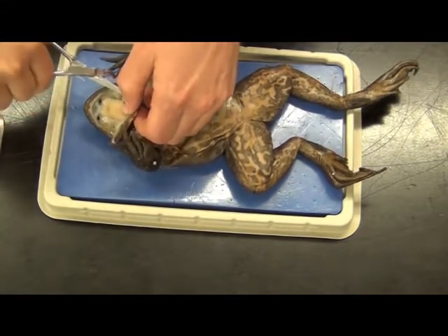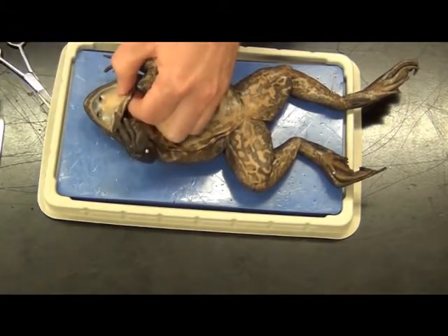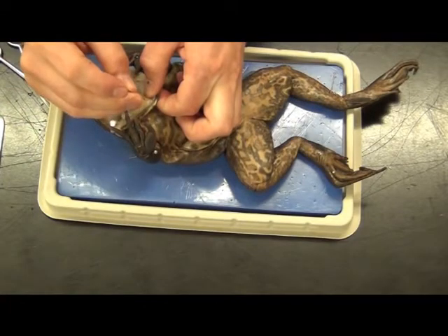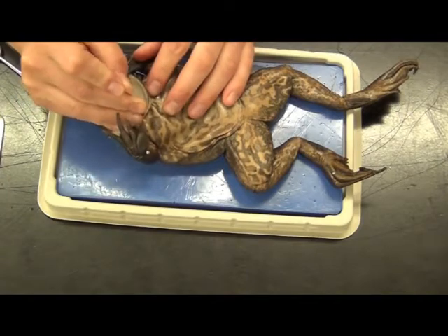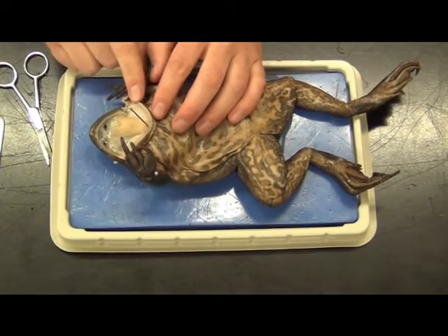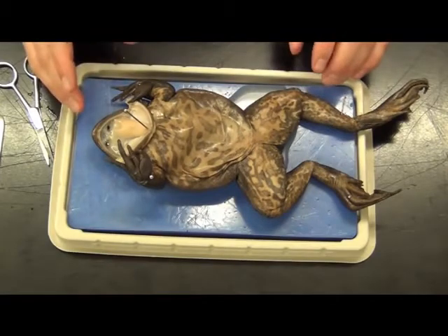I'm going to cut way on back on this guy, almost back to the front legs. Opening up the mouth, and sometimes I'll very carefully take a pin through the very end of the mandible here, poke it through, and barely pierce the chest plate. What that does is allow the mouth of that frog to stay pinned open while I look at it, label it, and point some of the features and parts out.